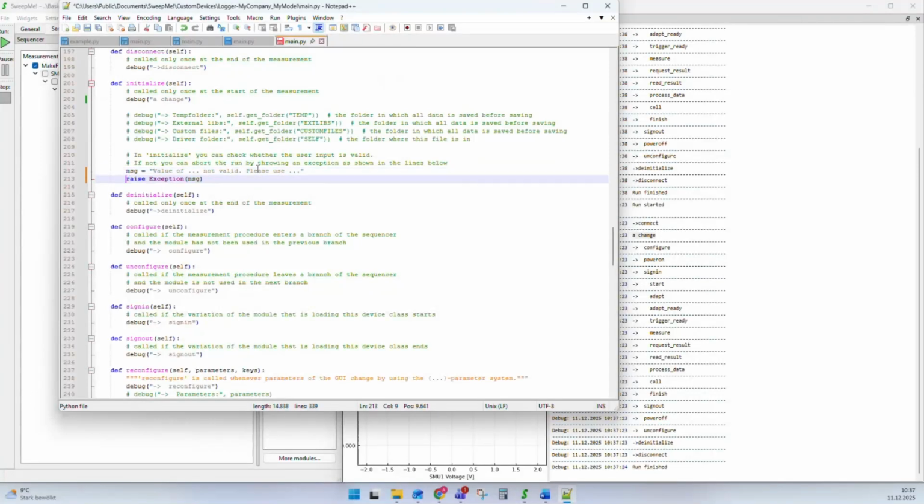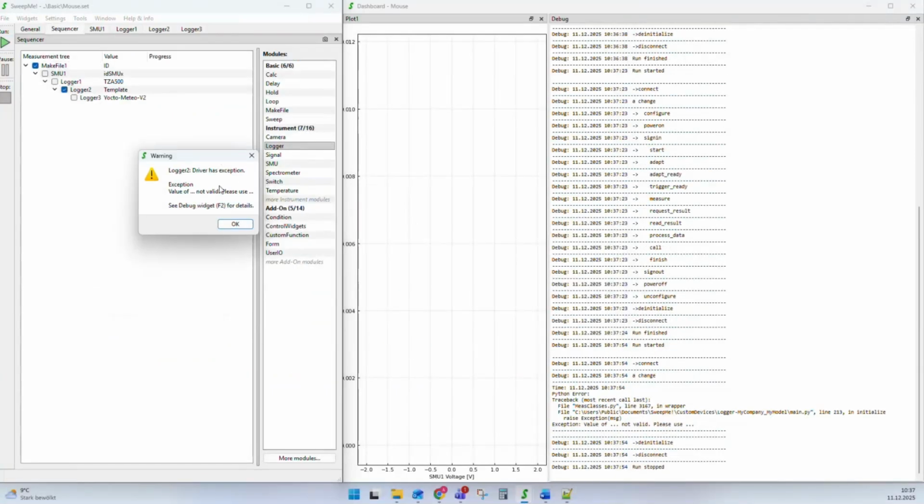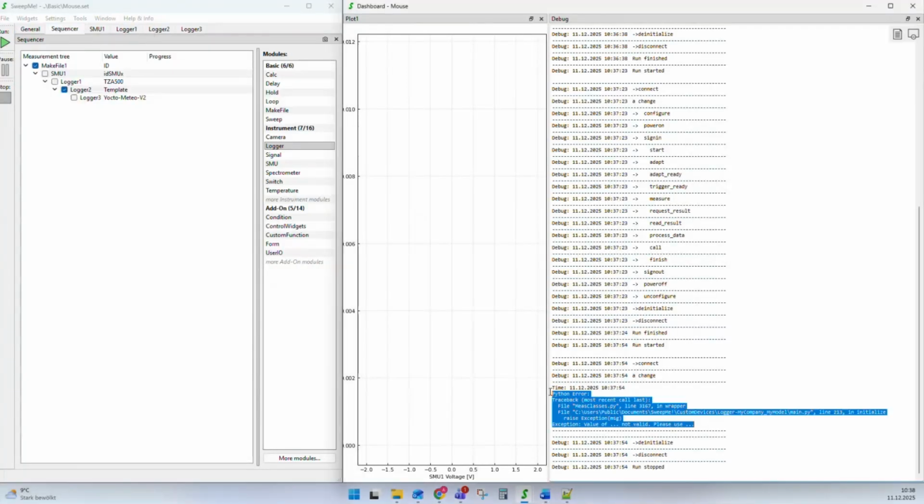The value was not valid. Please use something different. Here's as an example, then this exception is raised. I save the code, I run it, and a warning comes: Driver has an exception. The value, this is the message. And then it says the debug widgets F2 for details. The debug widget is this debug widget that you can see here. You can find that via widgets, debug, show hide. And now you can see here the full error code.